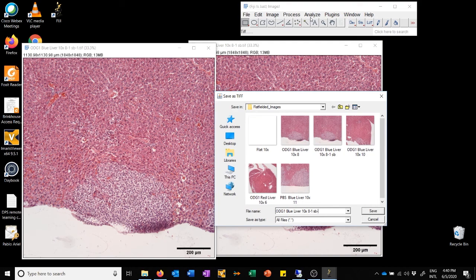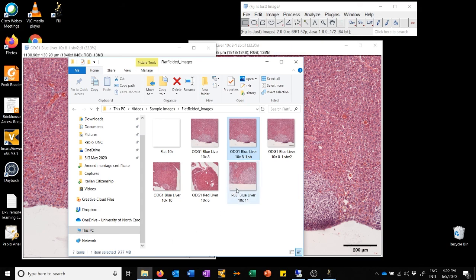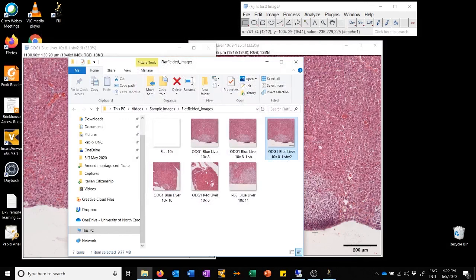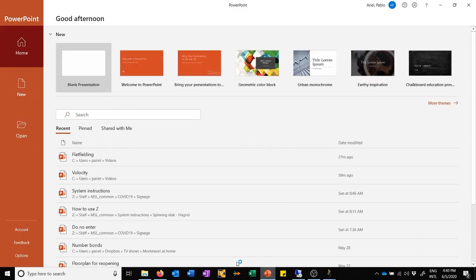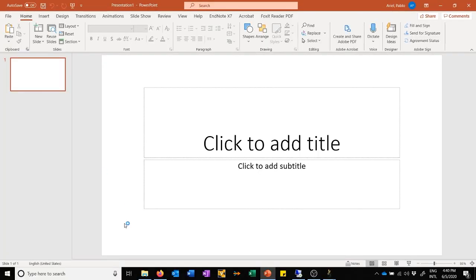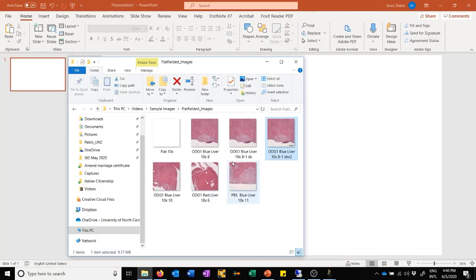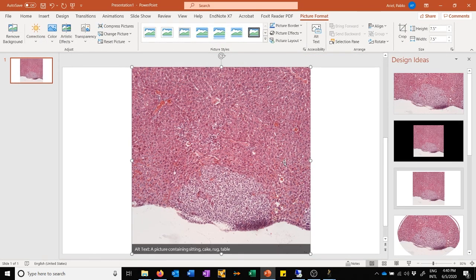and I save it as scale bar version 2, if we go back to the folder, you'll see that now if I double click it, it's there. The other thing to keep in mind is that in PowerPoint, sometimes the scale bars appear and sometimes they don't. So for example, let's do the following. Let's just drag this one that supposedly had a scale bar in. Yeah, so sometimes they appear and sometimes they don't.